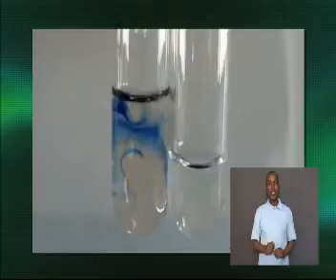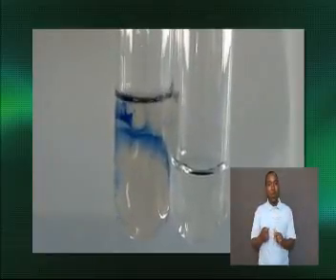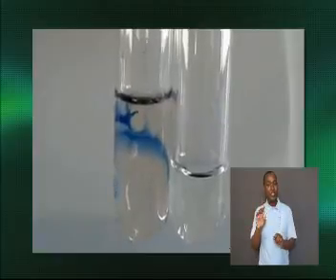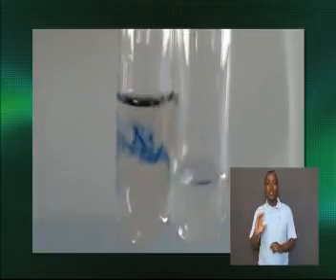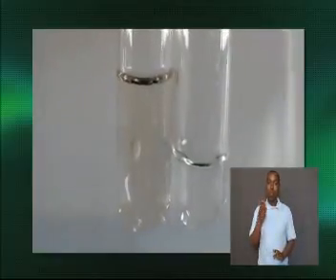So, if one of the items that is tested has a high concentration of vitamin C, the colorless product forms and the blue color disappears. If you tested a sample of orange juice and a sample of milk, what would each solution look like?